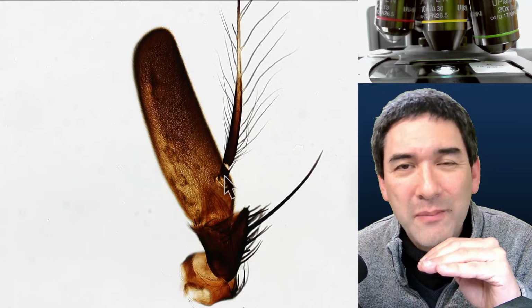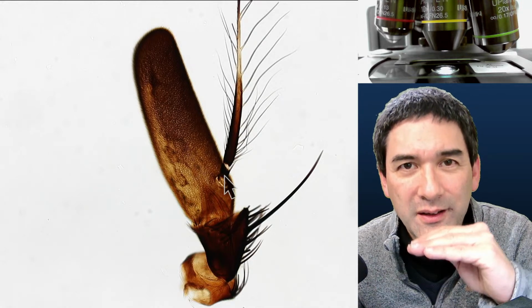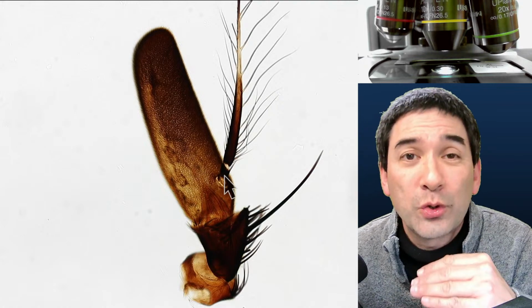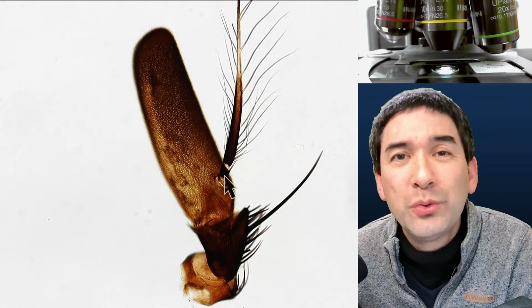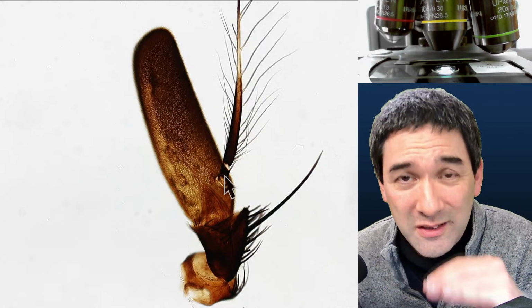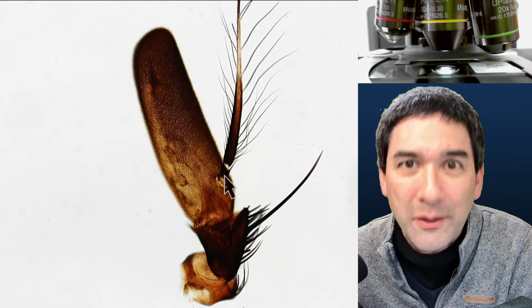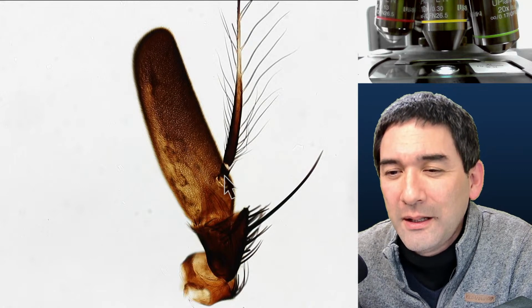If the people who made the slides were to cut the specimen, then they would call it longitudinal section or cross section, because then it's actually sliced. But in a whole mount, you do not slice it. So even if it's only part of an insect, if it is not cut into small sections, they still call it a whole mount. This is kind of the idea here.